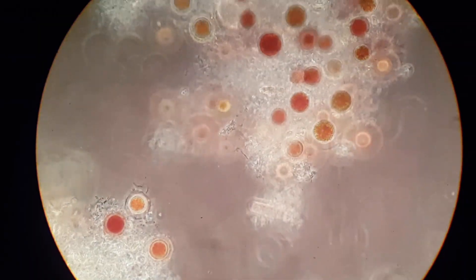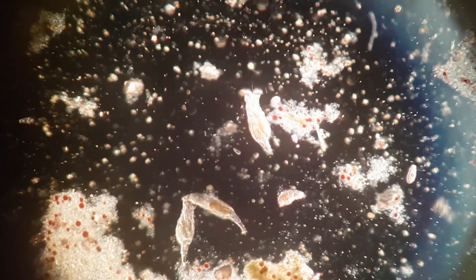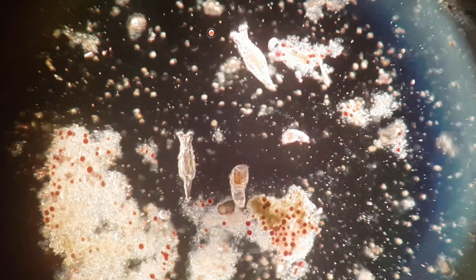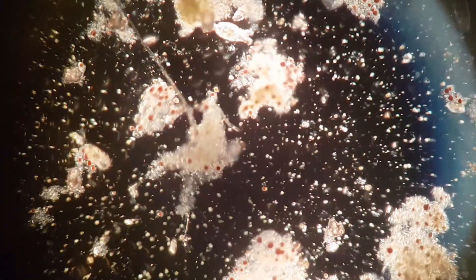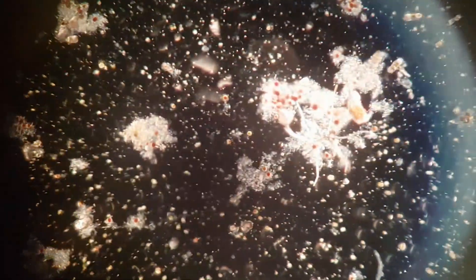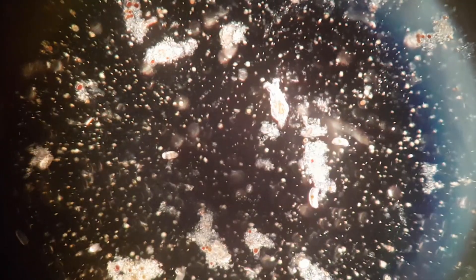These were just the microbes I had time to focus on, but as you could see there are a lot more microbes zooming around. If you recall the microbial community of this ecosystem at two and a half months old, you'll notice that it has become a lot more diverse. Even just looking at the scale of microbes, I think it is absolutely fascinating to see a large and diverse community of microbes consisting of completely different types, forming seemingly out of nowhere from an empty tub of water in just a matter of months. It is ecological succession on a small scale, happening right in front of our eyes, and I think that's just amazing.